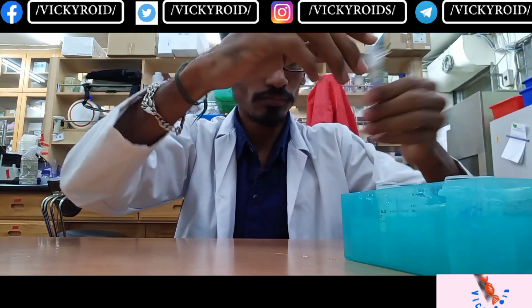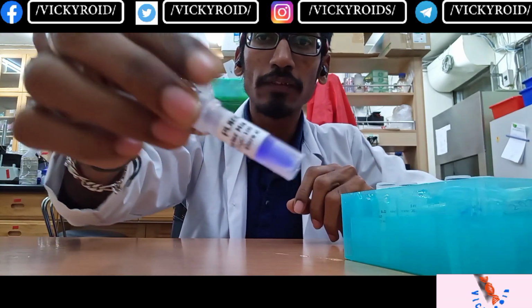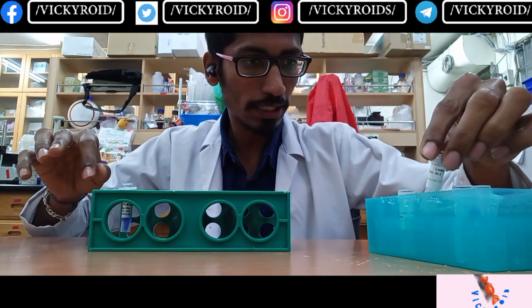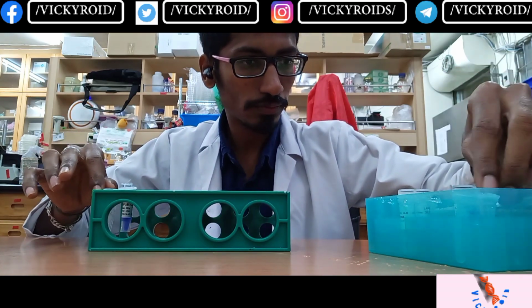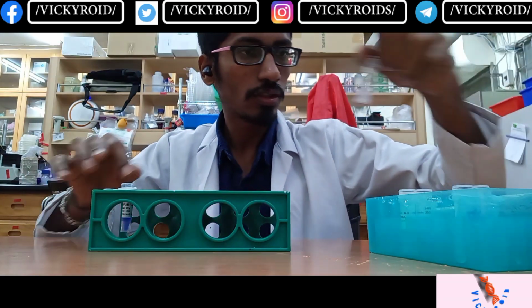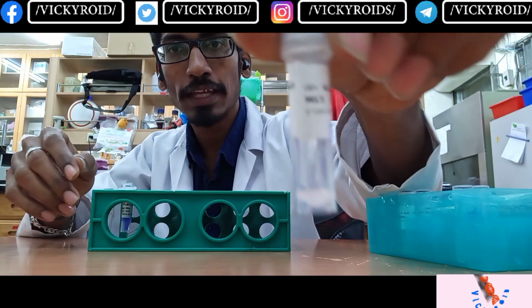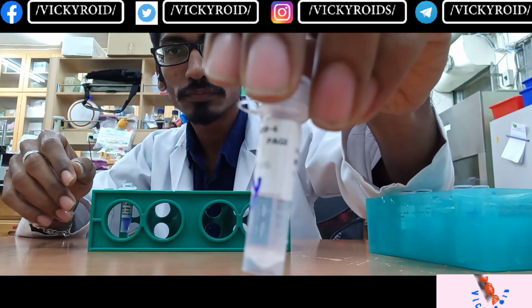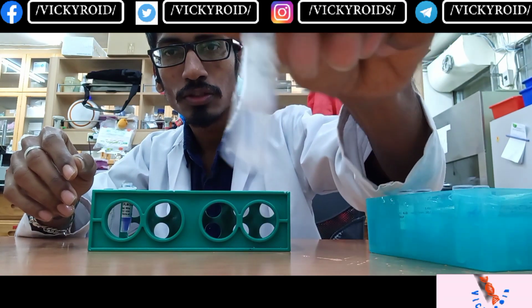This is the master mix that we have already purchased. I'm going to use this master mix for this RAPD, along with the M13 primer. So here it is, the M13 primer, and this is the working stock of the M13 primer, which I have already prepared.